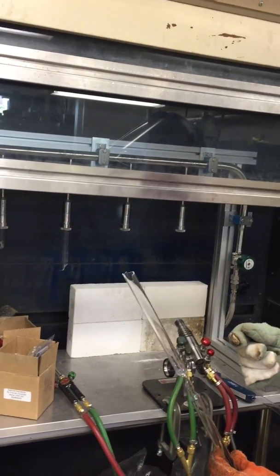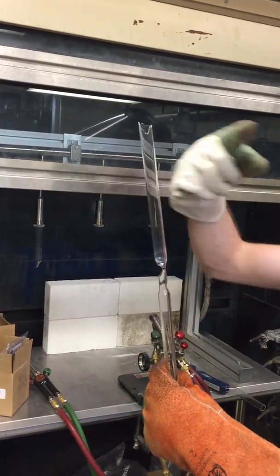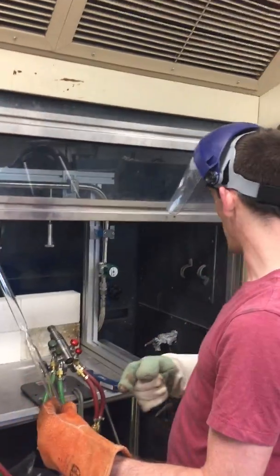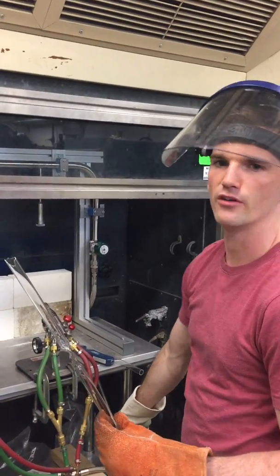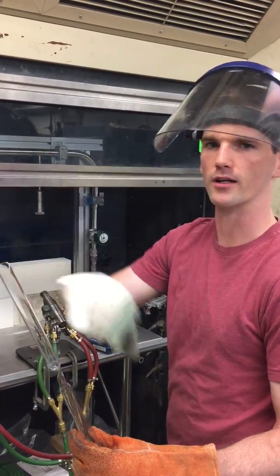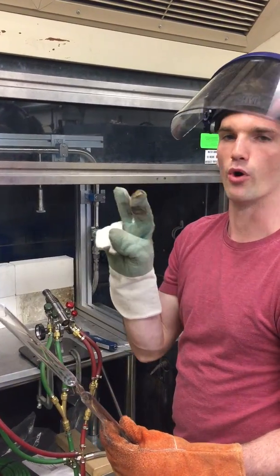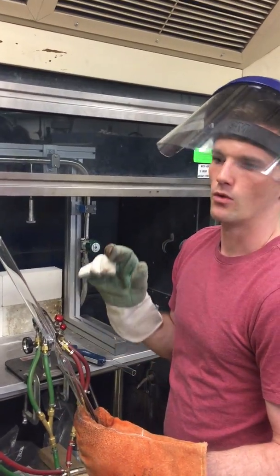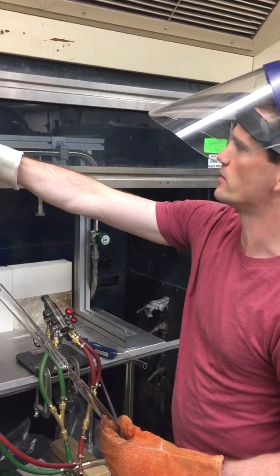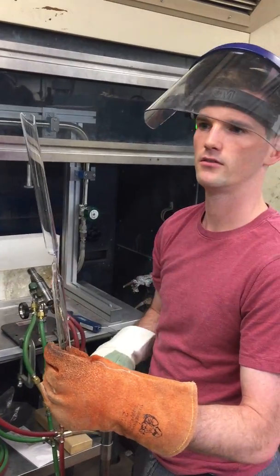Put the loose end up into here and you're going to turn on the argon tank. You're going to basically fill this up with argon, let it flow and circulate through this, and you may also pull a vacuum from the other side — do a few cycles of put in argon, close the argon, pump it out, put in more argon, pump it out. That's what they call poor man's vacuum — you're getting rid of all the oxygen on the inside. While the vacuum is pulling, there's usually a vacuum gauge with a dial up here to tell you what the vacuum level is. Get it as low as you can, and then use the hand torch while the vacuum is running to pinch off the other end, and then it's all set.